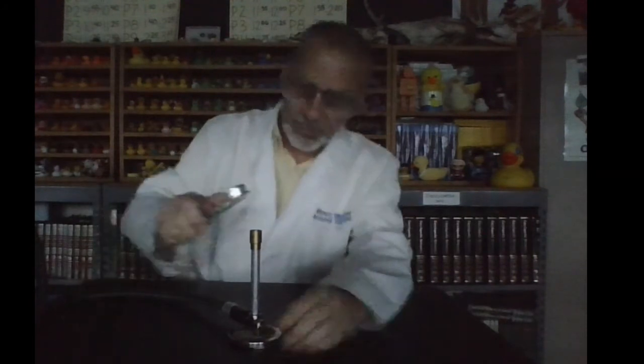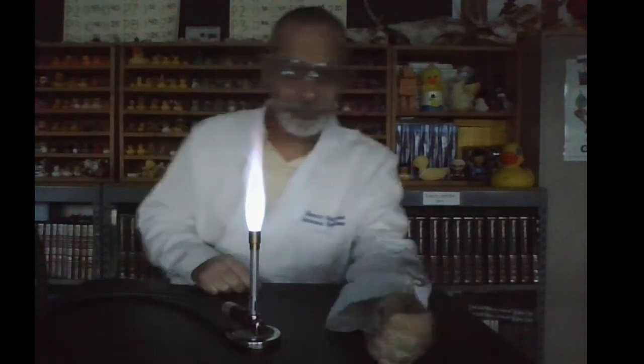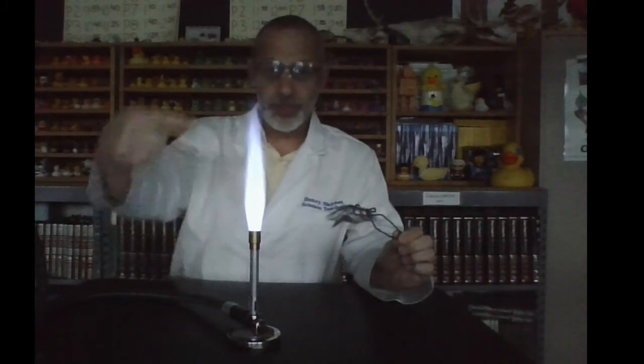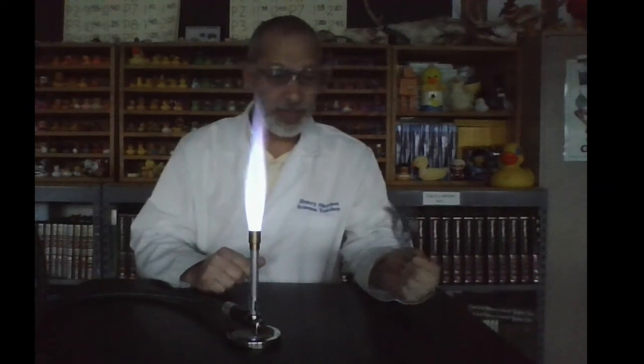Here we go. I am going to turn the system on and light the burner. Now, what kind of flame do we have? A bad flame. How do we make it a good flame? Adjust the collar. So now we have a good flame. I have the iron right here in my forceps, which I am now going to place into the flame. I want you to watch and listen and record your observations. There is a light blue flame within the darker blue flame — we want to put the substance at the top of the light blue cone, which is the hottest part of the flame.